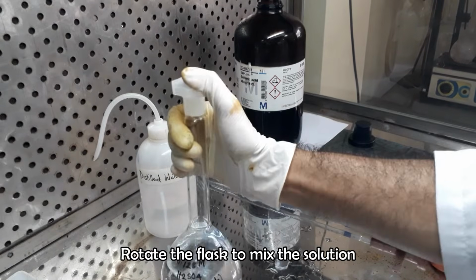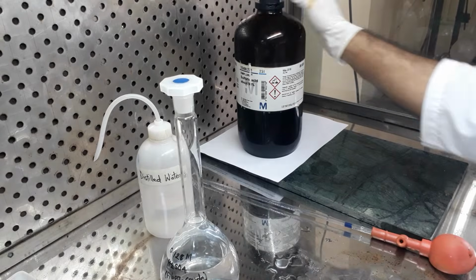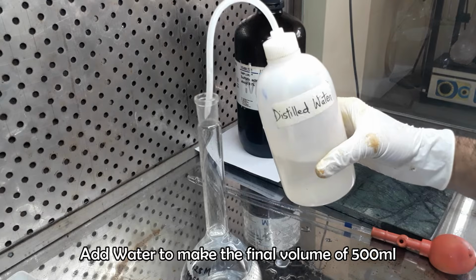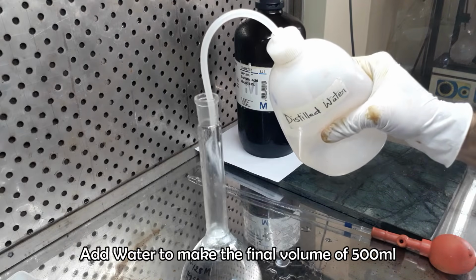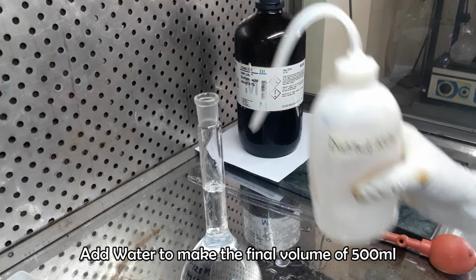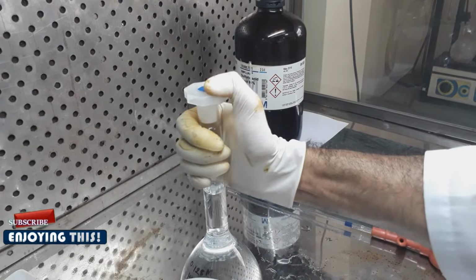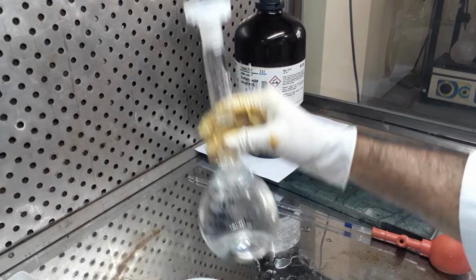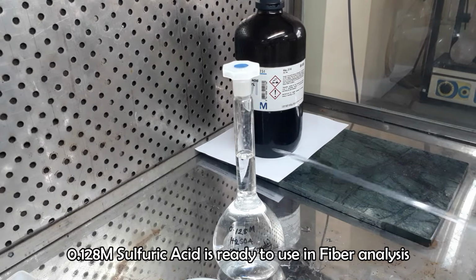Rotate the flask several times for proper mixing of acid with water. Finally, add enough distilled water to make the final volume of 500 milliliters. 0.128 molar sulfuric acid, ready to use in the fiber analysis.